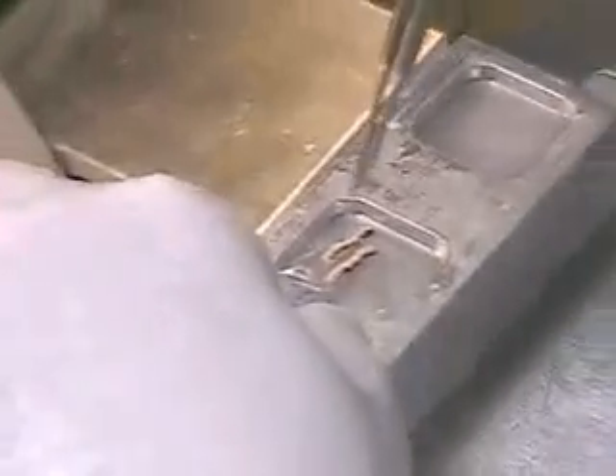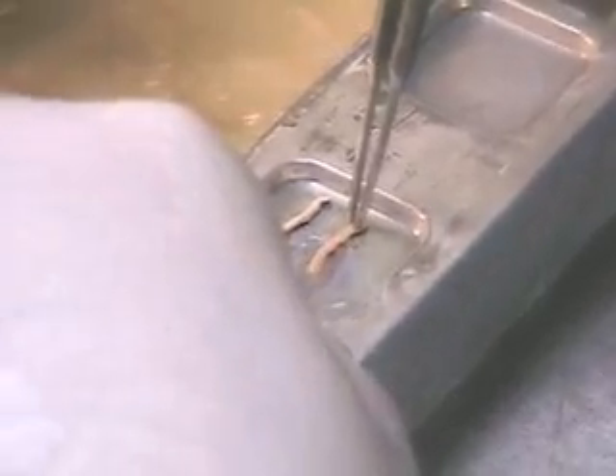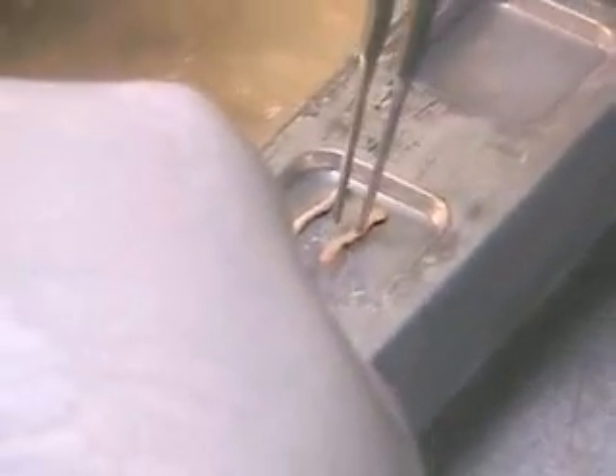What I'm going to do here is just gently pull this one off. The reason this works so well is when you touch the tissue to the freezing well base, it sticks. Then I can just manipulate that tissue precisely as it's coming off, so I can see that margin. And of course it's going to be very flat. I'm paying a great deal of attention to the margin coming off.